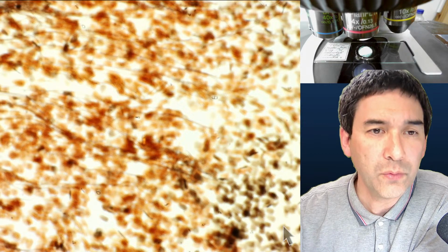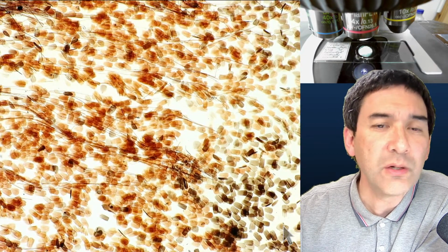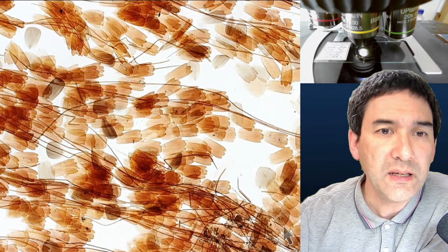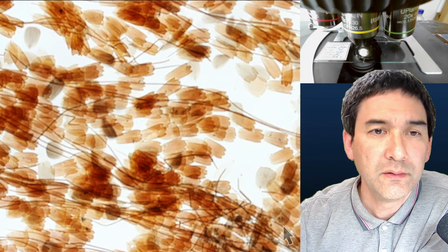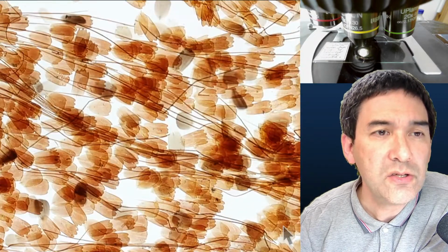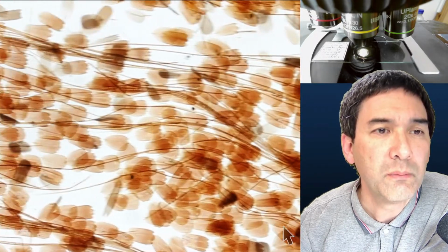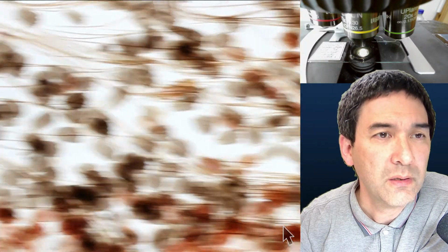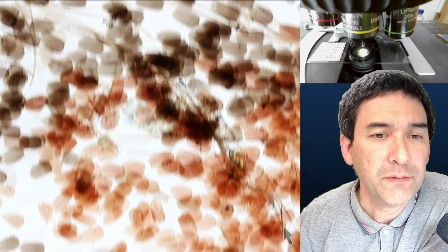So let's have a look here again. You always start at the lowest magnification. So let's go down a little bit here. It's blurry, of course. This is how it looks like. Okay, we might really want to go up a little bit more. So these are the scales of a butterfly. Okay. I don't know what those lines are. It could be some, I don't know, a little bit too long for here, I would say. Yeah, but in any case, these are butterfly scales.